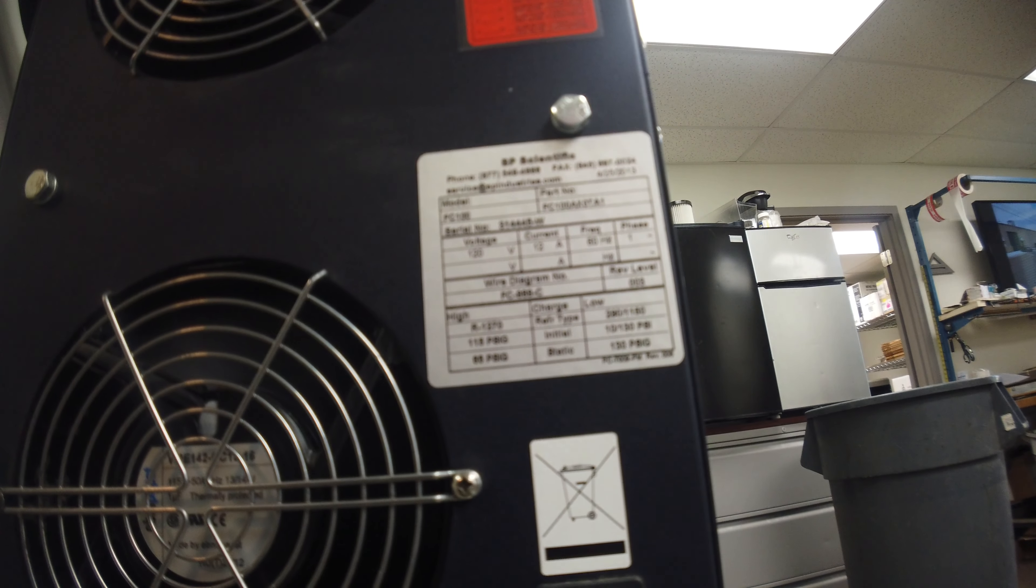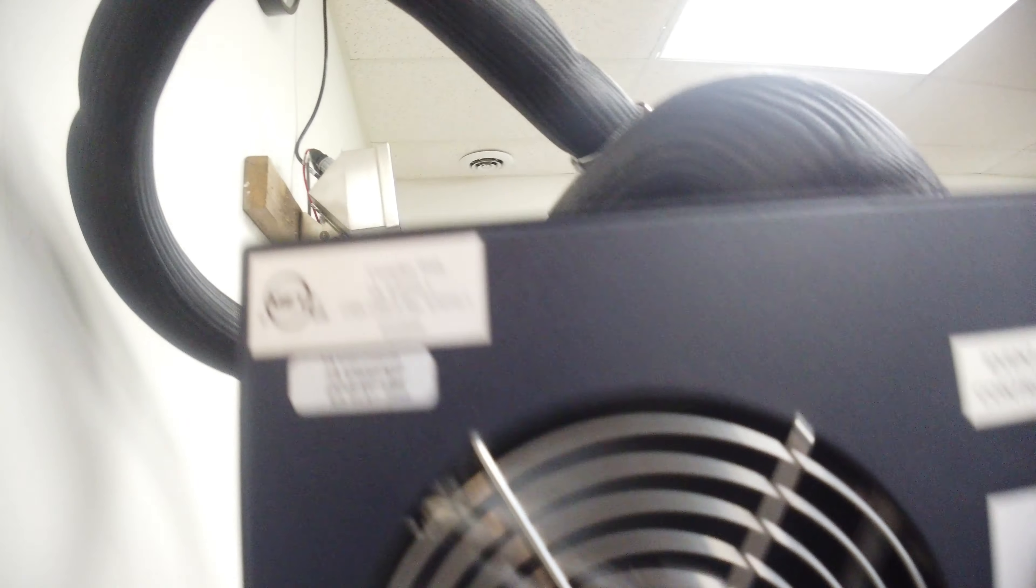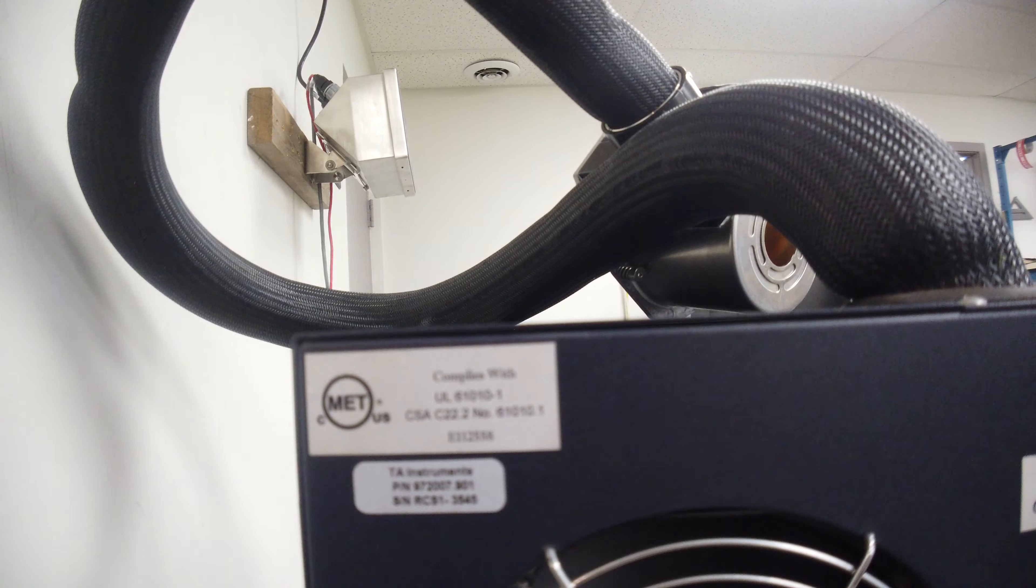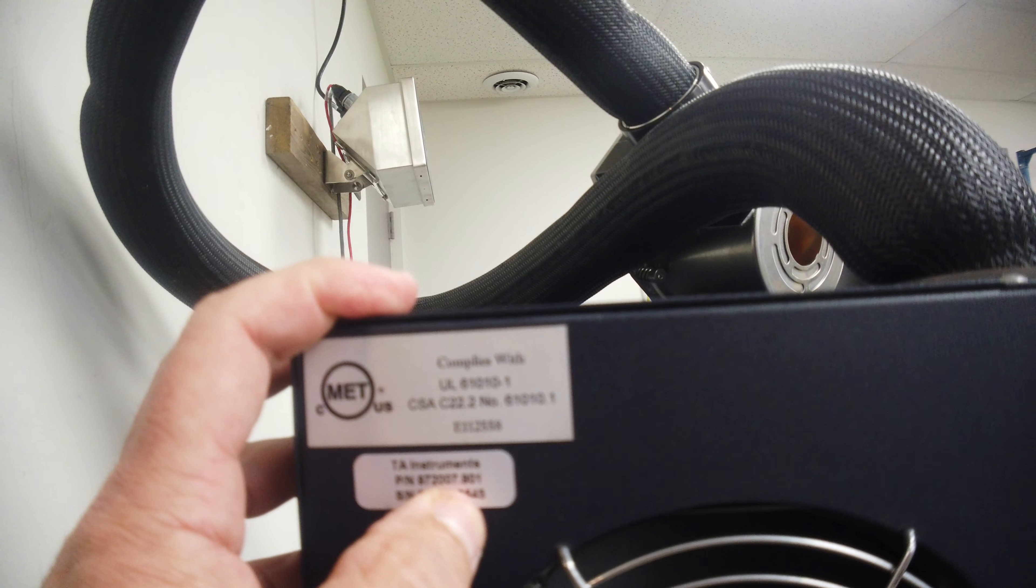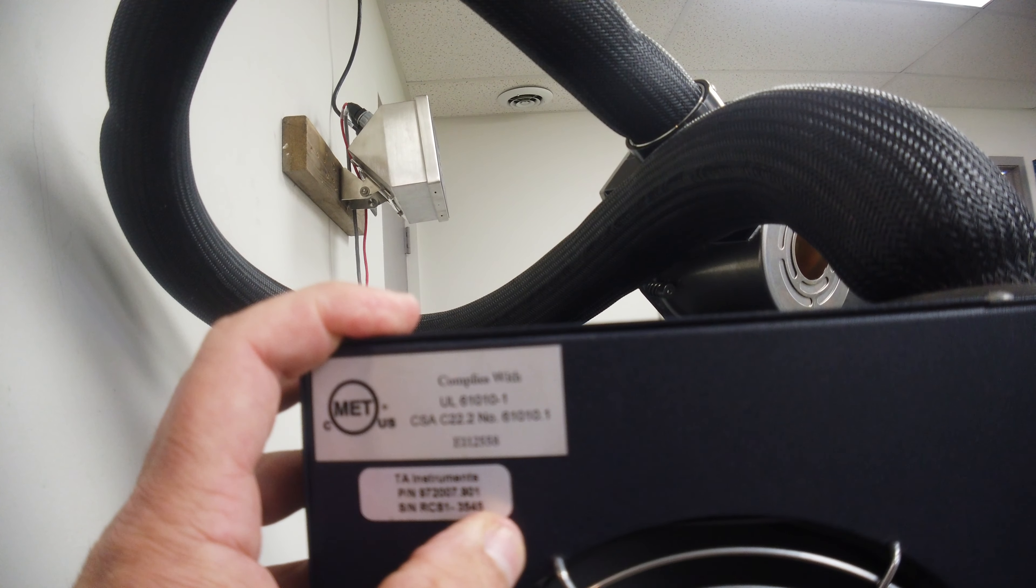It's tested 523 or 13. Doesn't really help us. Part number is 972-007-901.